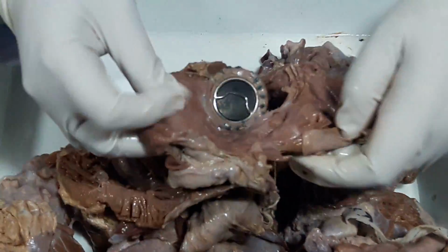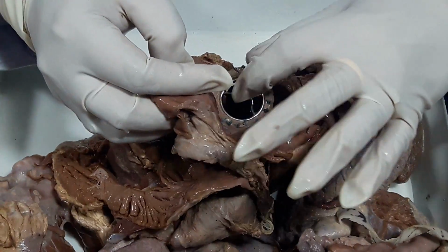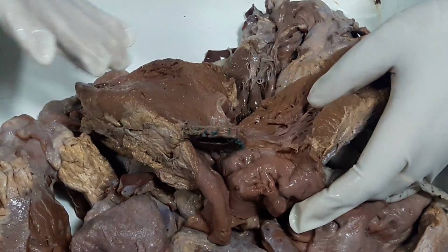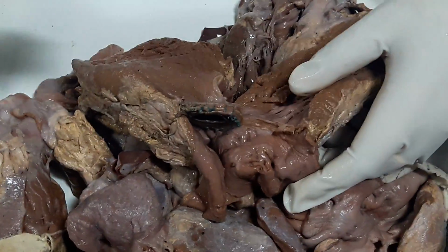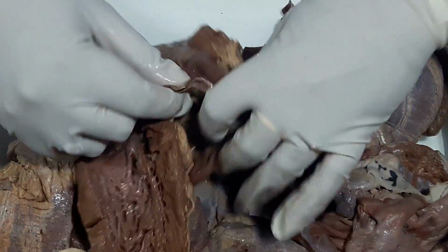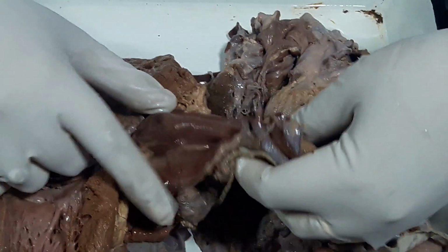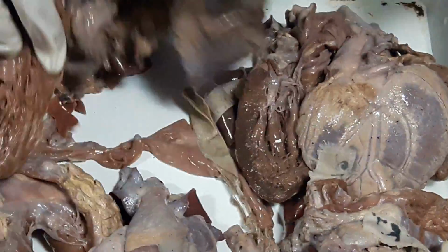this is the left side. You see left atrium is dilated. In mitral position there is a tilted disc kind of metallic valve. Okay, the left ventricular inflow is simplified because the papillary muscles have been taken out due to surgical reasons. Okay, and the aortic valve is normal. Aorta is showing atherosclerosis, fatty streaks. Okay.